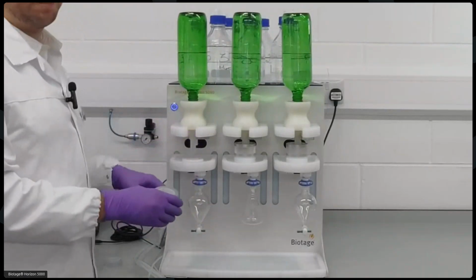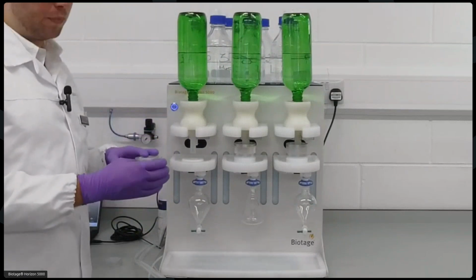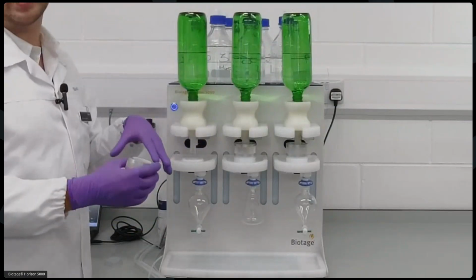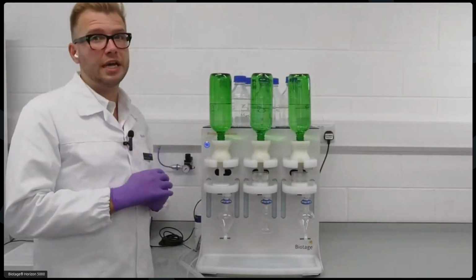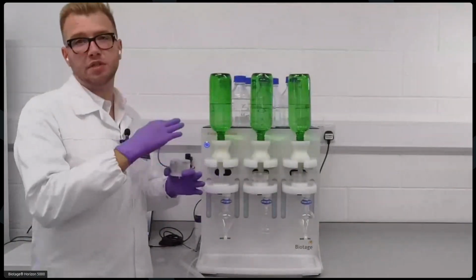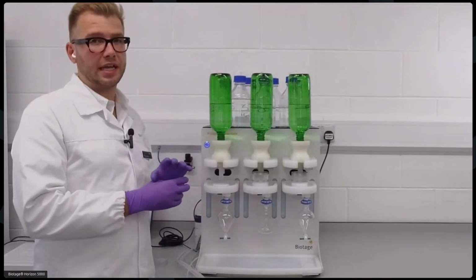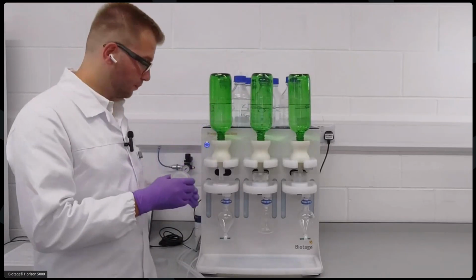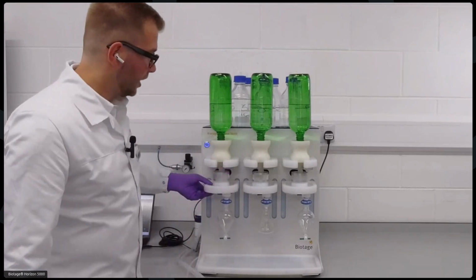Now, of course, depending on how particulate rich samples you have, we have also pre-filters to layer up the extraction and allow filtering during the extraction. If you have really challenging matrices that contain really fine suspended solids, then you can use diatomaceous earth as well as quartz wool to really increase those layers and help the sample to process directly. And as I've mentioned, this really eliminates any pre-extraction sample workup.